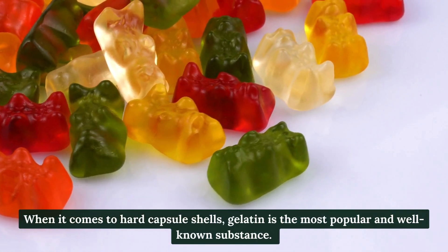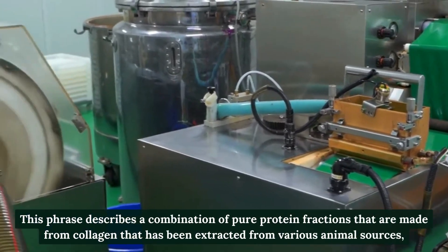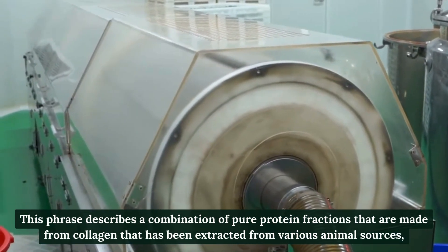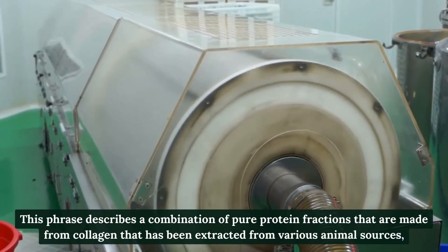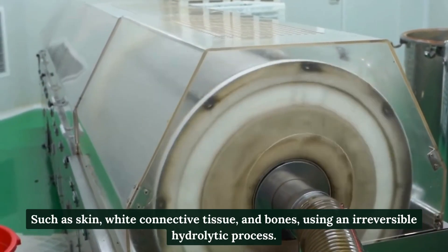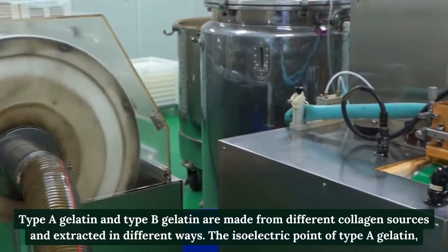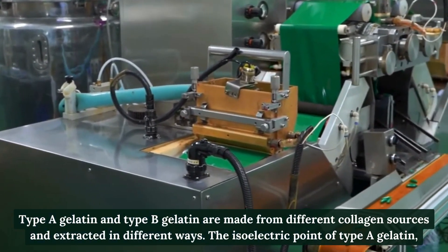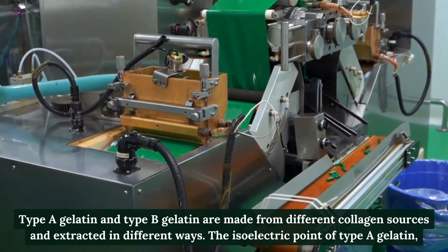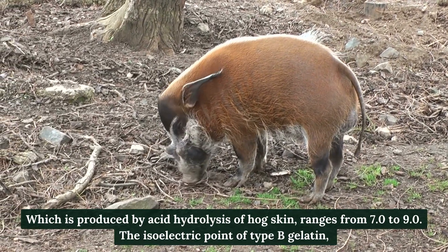Gelatin is the most popular and well-known substance used for hard capsule shells. It describes a combination of pure protein fractions made from collagen extracted from various animal sources — such as skin, white connective tissue, and bones — using an irreversible hydrolytic process. Type A gelatin and Type B gelatin are made from different collagen sources and extracted in different ways.